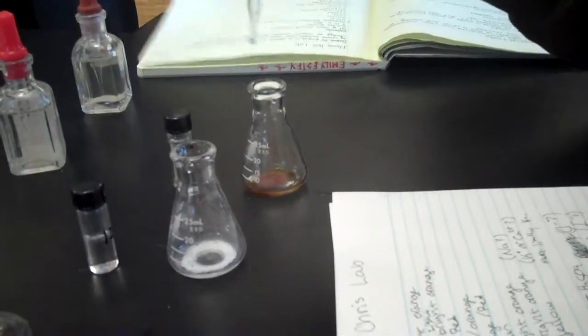No, this one is the one where it's supposed to do the fogging thing. Oh, I mean foggy. Yeah, it's supposed to turn reddish brown foggy.